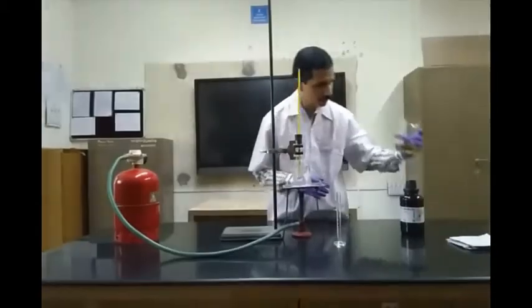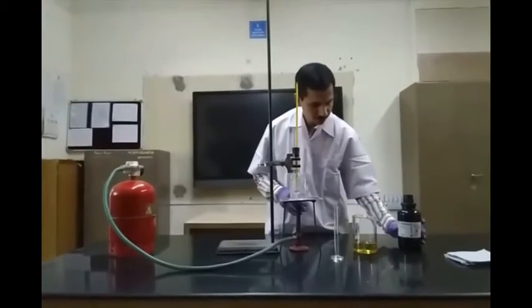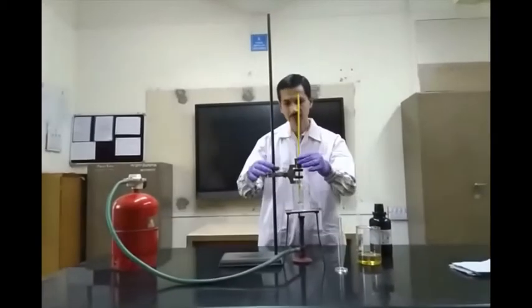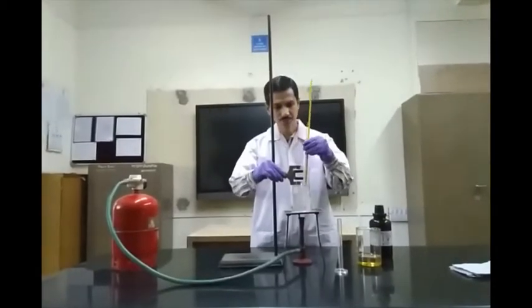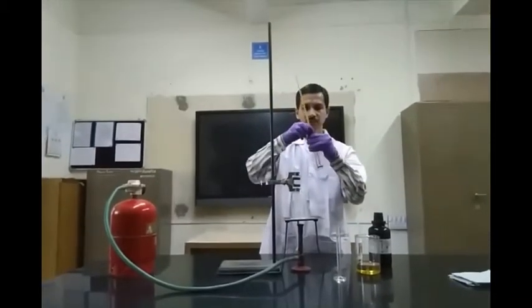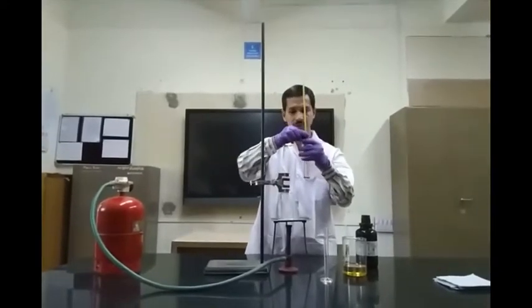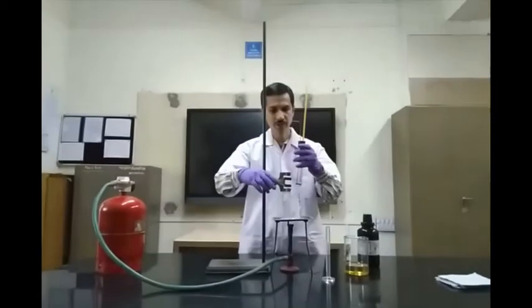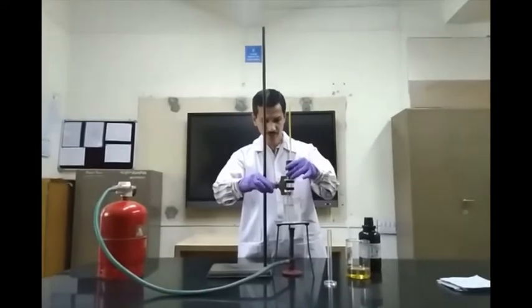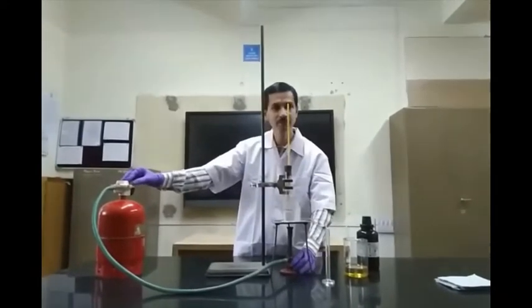We require a sample of diesel and aniline. Both of them will be mixed in a test tube. In this test tube we will also have a stirrer and a thermometer. We take equal quantities of aniline and diesel in this test tube.